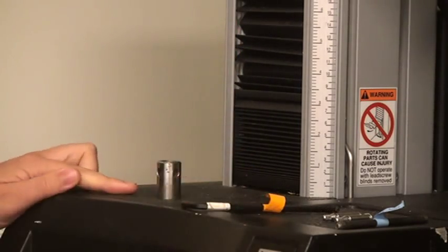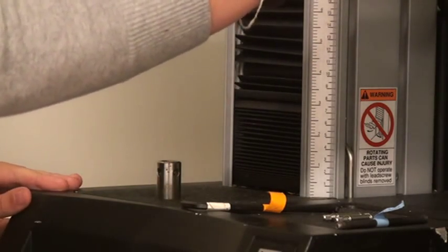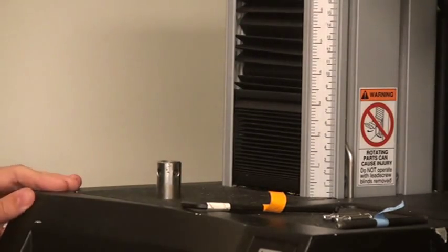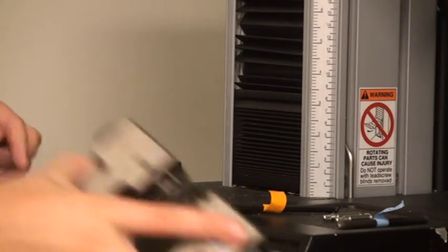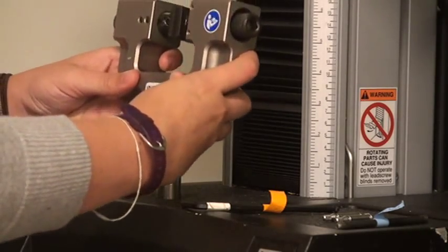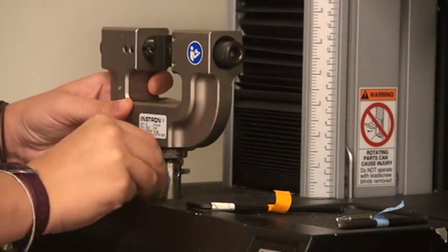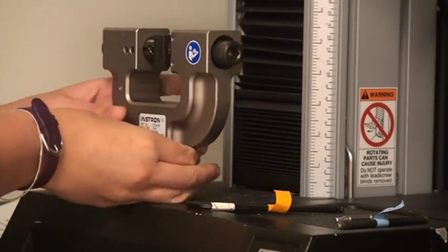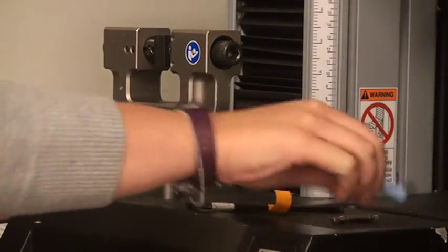Once the collet is in place, you can begin installing the grips. You may need to use the keypad to jog the actuator upward to make enough room to install the grips. Insert the pin connector on the lower grip into the lower collet, align the holes, and insert the clevis pin. Tighten the lock nut clockwise so it is tight against the lower collet.